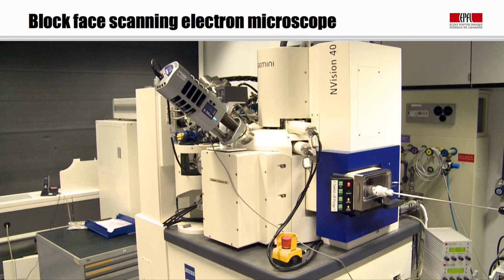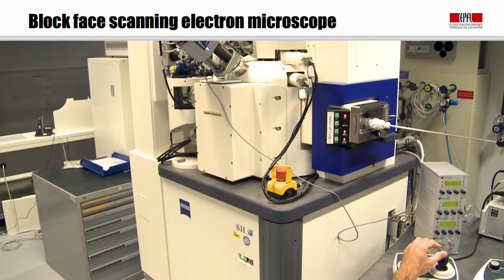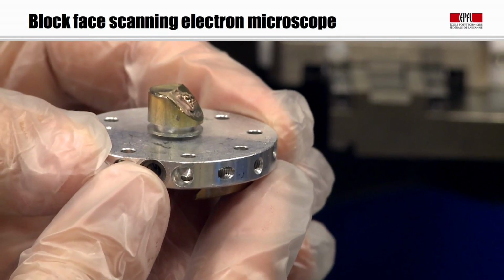So I'd now like to show you a video of how we use the focused ion beam scanning electron microscope, or FIB-SEM, at the EPFL. Here is the machine, and we first of all take our sample and load it onto a carrier.